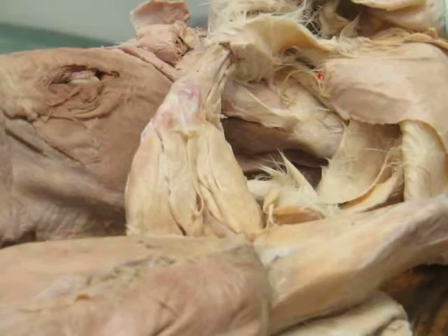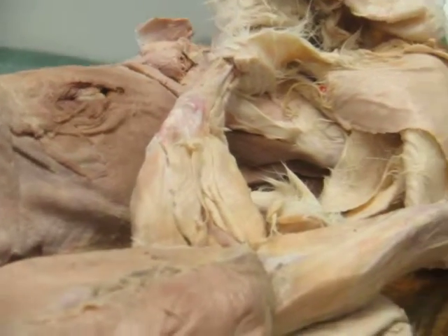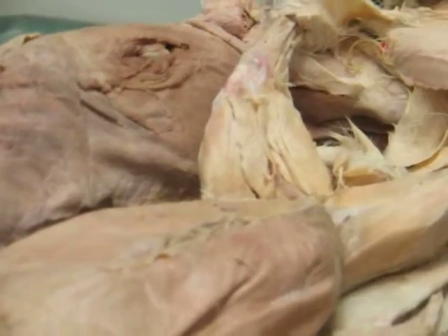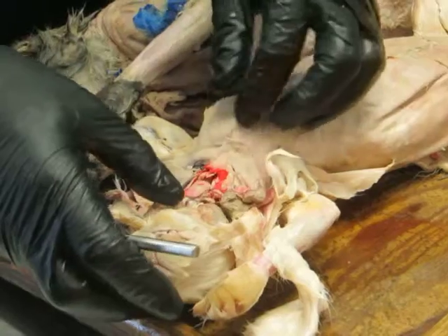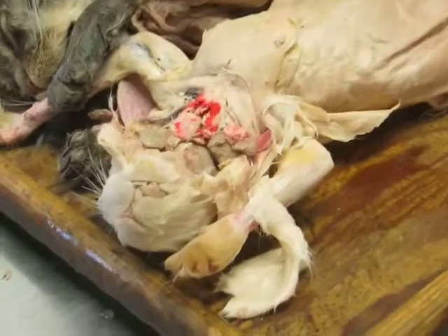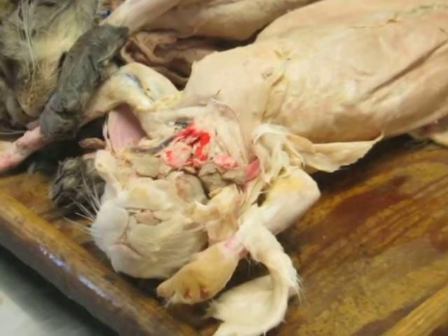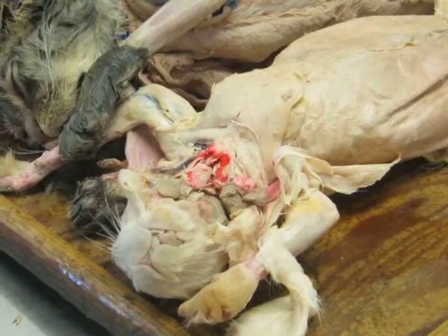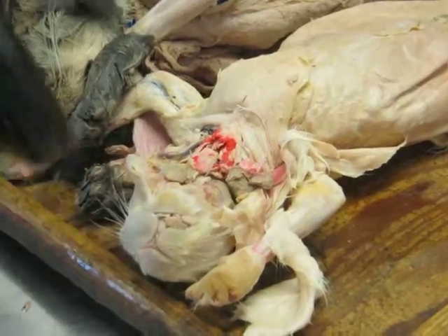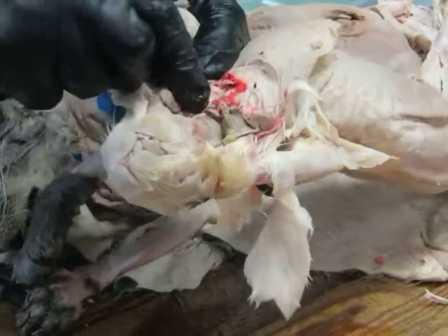So then we have a little bit more. We did have some muscles up here that we haven't looked at yet. And on the cat, I don't believe we've really gotten there yet. No, but fortunately this rabbit, they are go-getters. You guys got to this on your rabbit. So let's take a look at just a few muscles here. Basically, the muscles we have to look at are the hypobranchial muscles and the branchiomeric muscles of the mandibular and hyoid arches. Okay. And can't quite see all of them, but we can see most of them here pretty well.